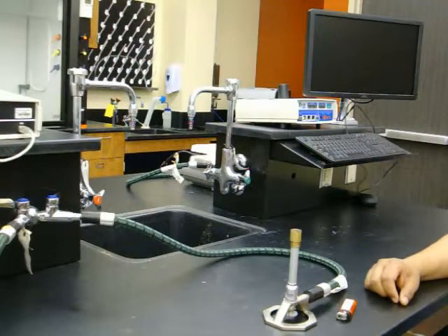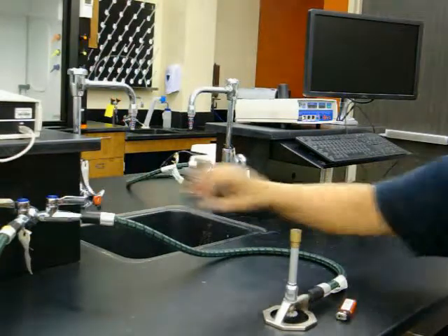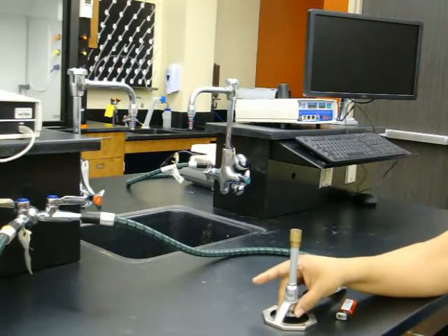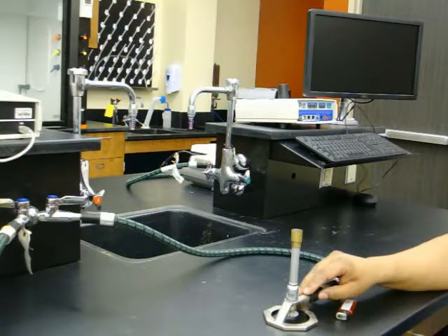When using a lighter, turn the main valve on parallel to the hose. Turn on the gas valve at the bottom of the Bunsen burner and slowly raise the lighter from the base to the top of the barrel until ignition.